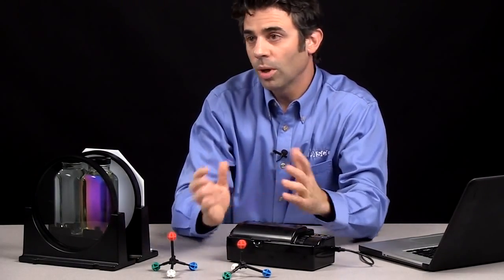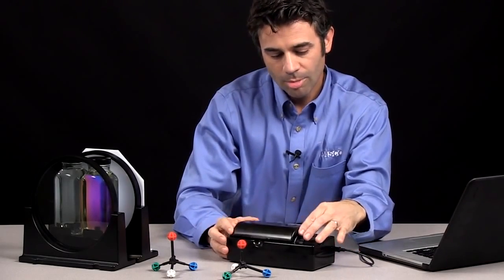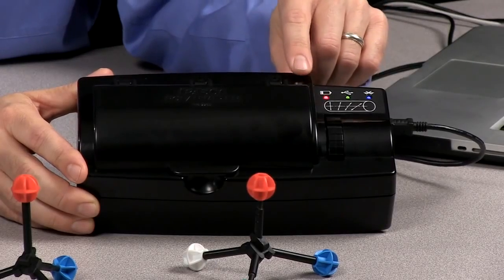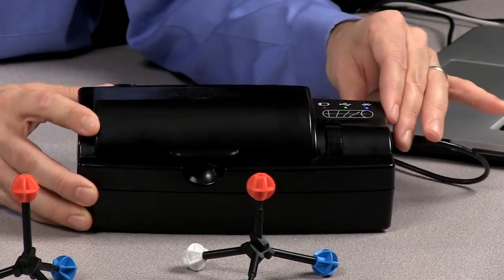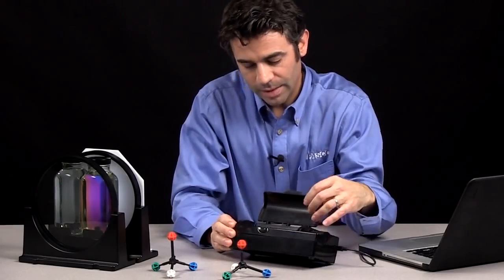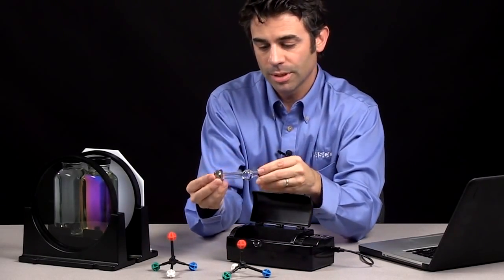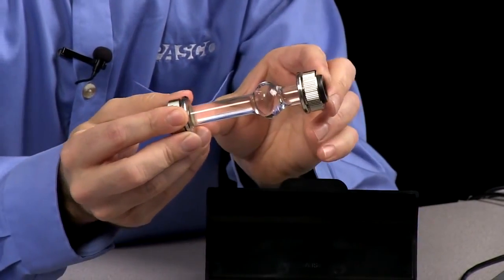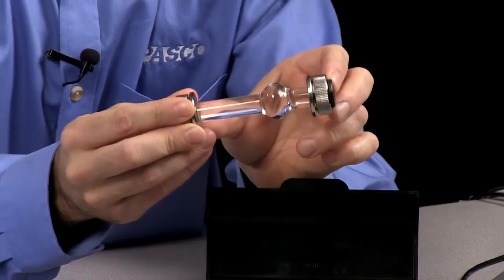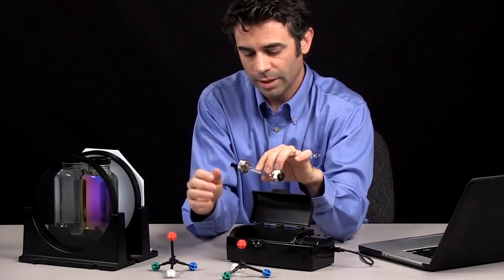Now what we want to do is we want to quantify that. So to quantify that, we're going to use our polarimeter. Polarimeter, simple turn on power button right here. It can be connected via Bluetooth or USB. Inside, there is a sample cell holder. And here's a sample cell. So this sample cell just has water in it, but it's a 100 millimeter sample cell with quartz ends, so it won't affect any of the light.